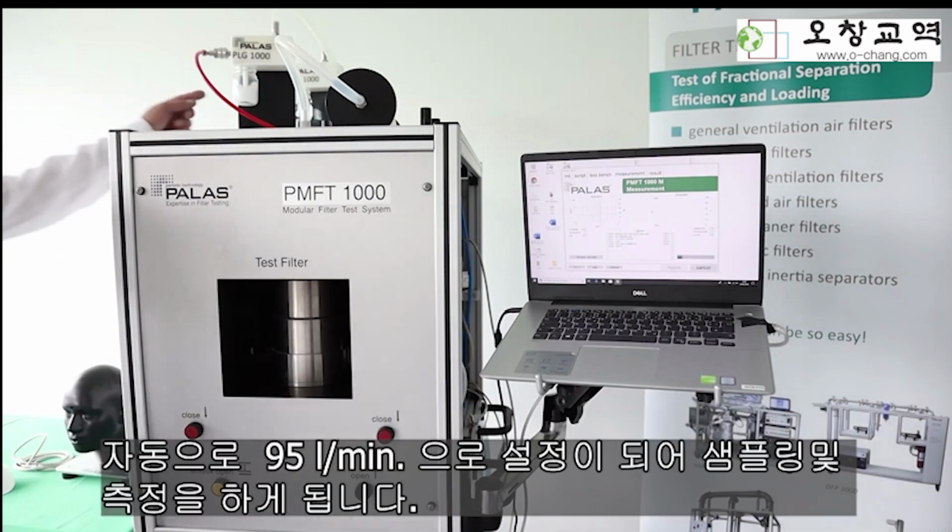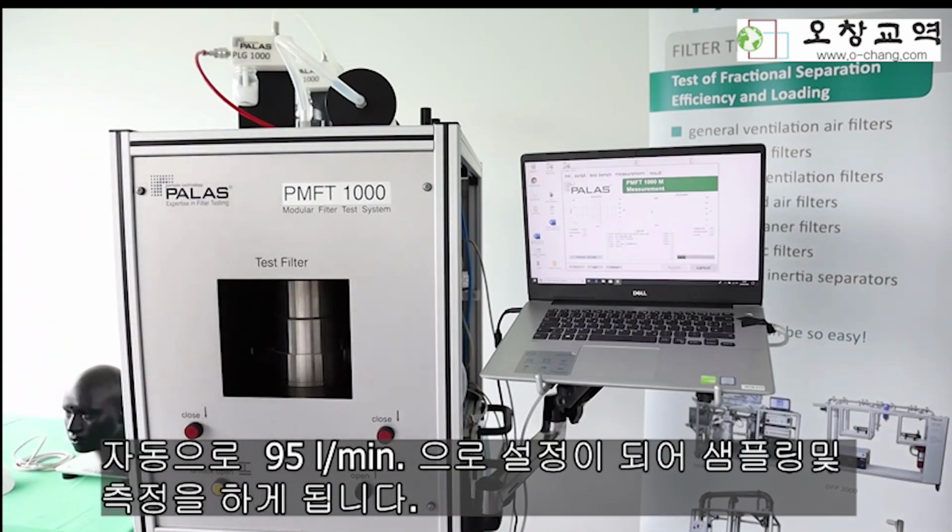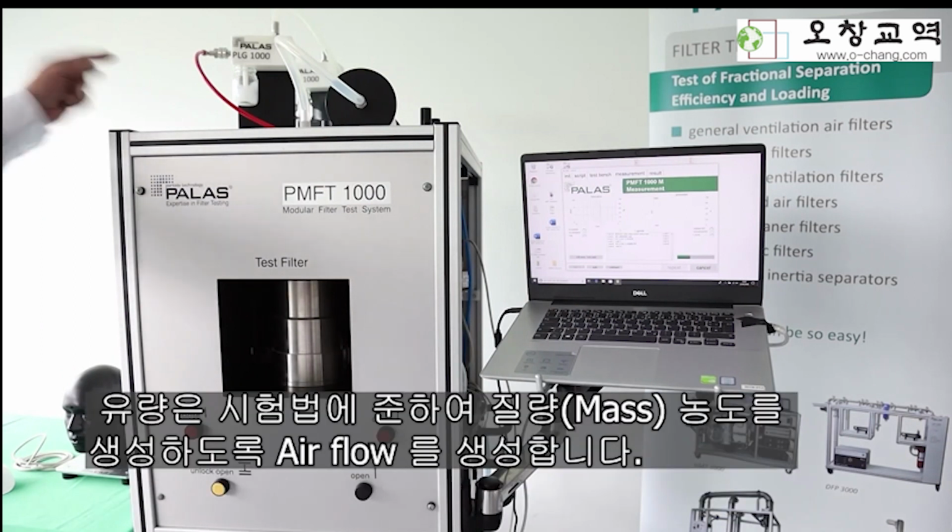You see the generator is starting bubbling. You can hear the airflow. Airflow is automatically set to 95 liters per minute. The generator airflow is set in a way that you reach the mass concentration according to the standard. It's a calibrated airflow according to what the standard needs.